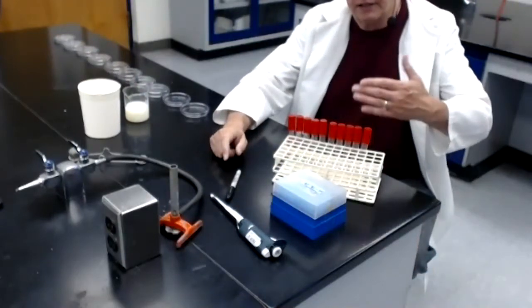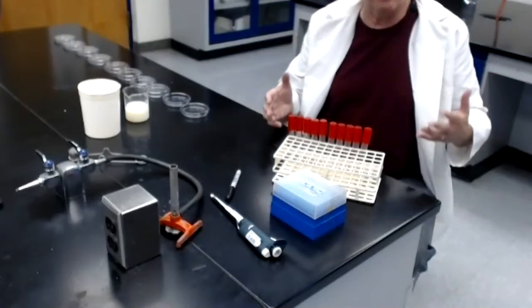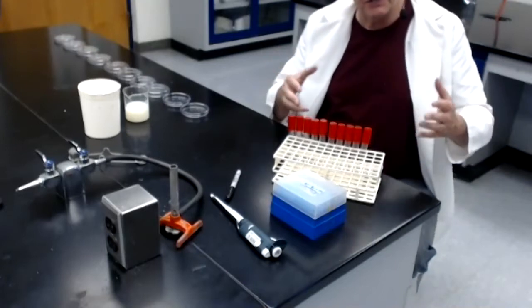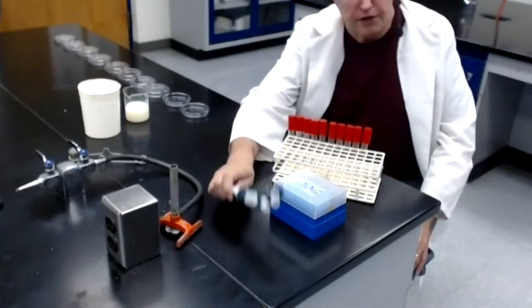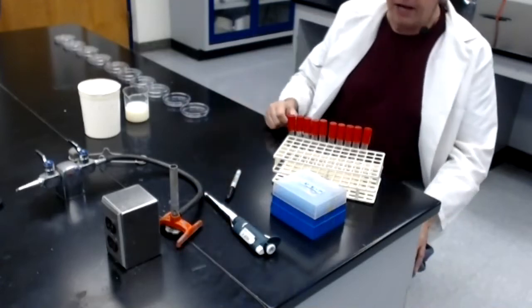Hopefully you watched the previous video where I spent a few minutes talking about pipettes and micropipetters and tried to explain the differences among them. If you haven't watched that video, I recommend you watch it first and then watch me use the micropipetter to carry out the dilutions for this lab module.